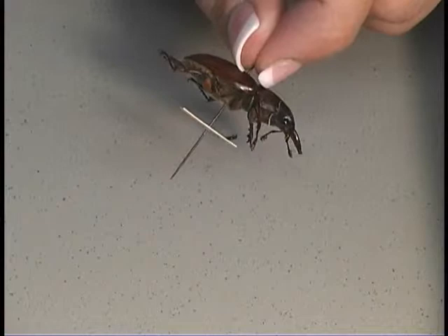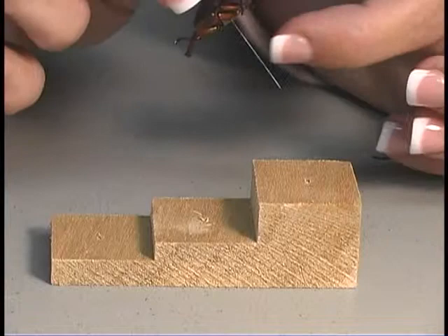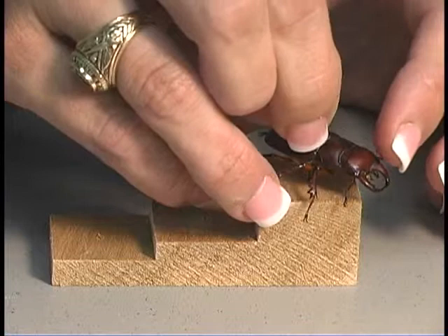In order to get the insect as well as the label in the correct place, we can use a pinning block. You place the insect onto the pin, and then for proper adjustment for height, you simply place the pin inside the first block.